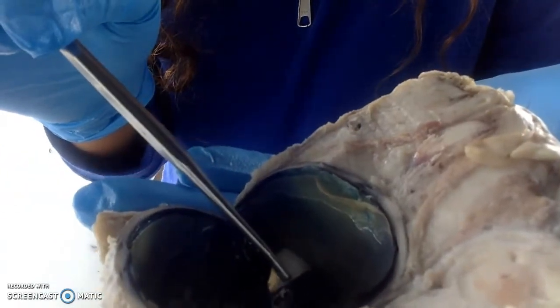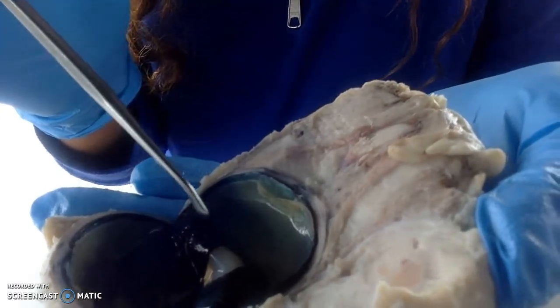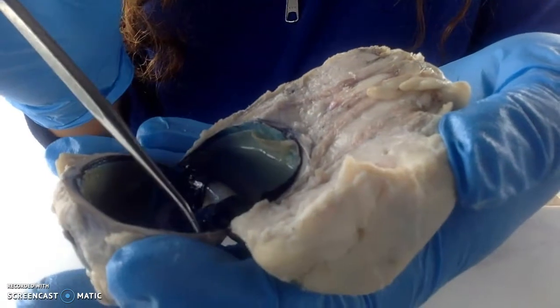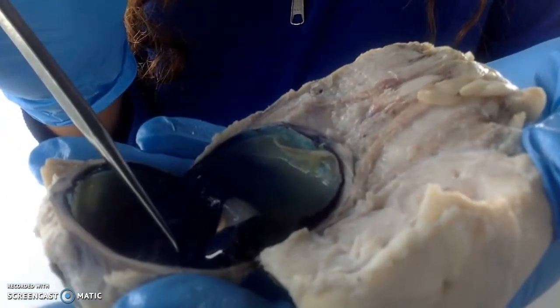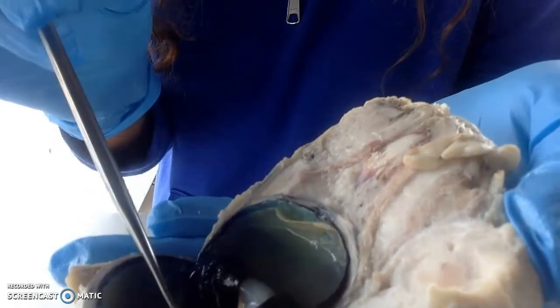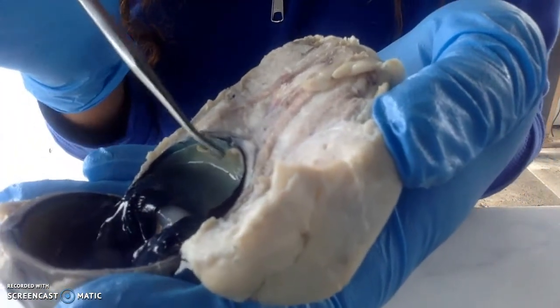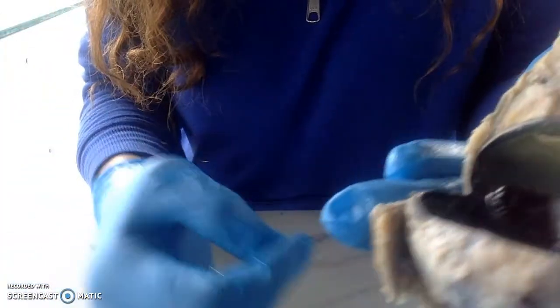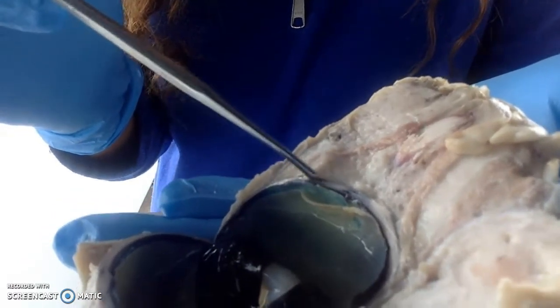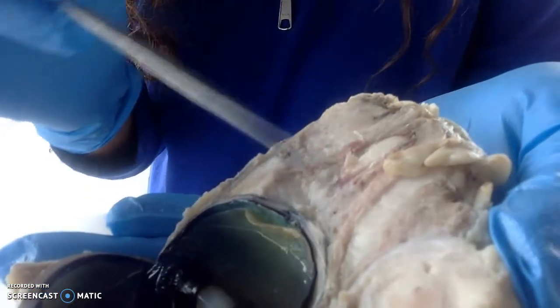We have the pupil, and the iris, anterior, and the inside anterior, posterior is right behind it. The vitreous humor, it's all this goo inside here. Retina, that yellow layer, the retina, the choroid right behind it, the black matter, and then the skin-like, very thick sclera, and then again the optic nerve.